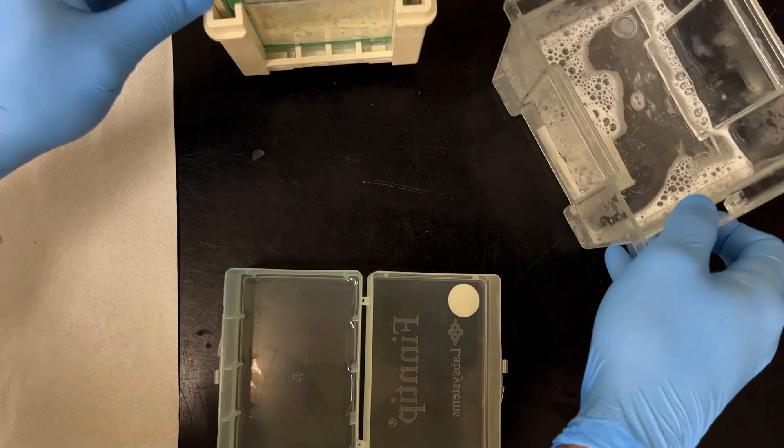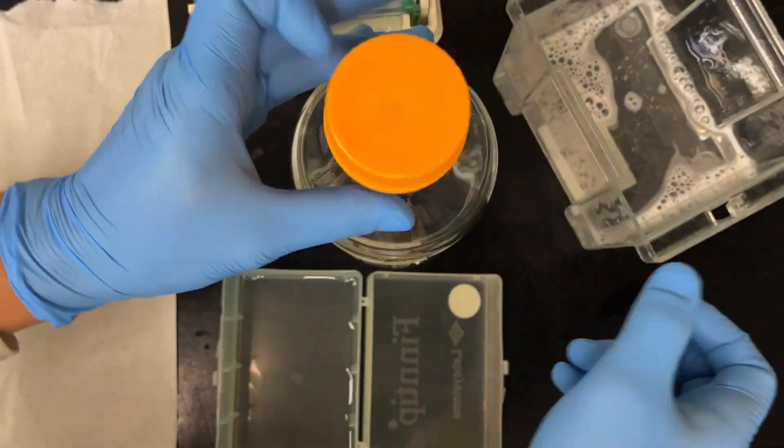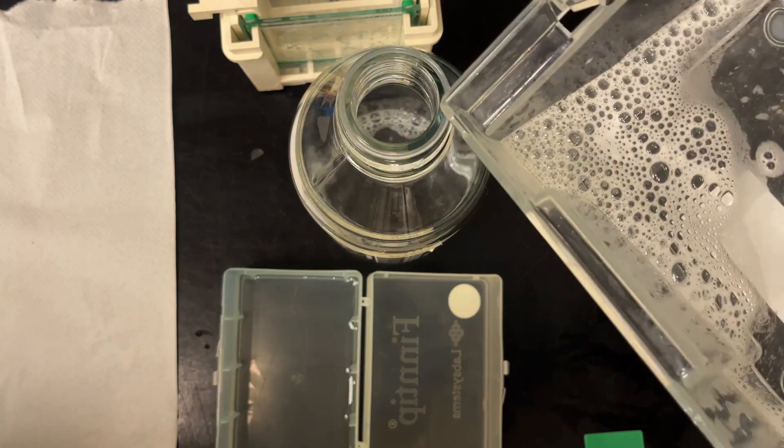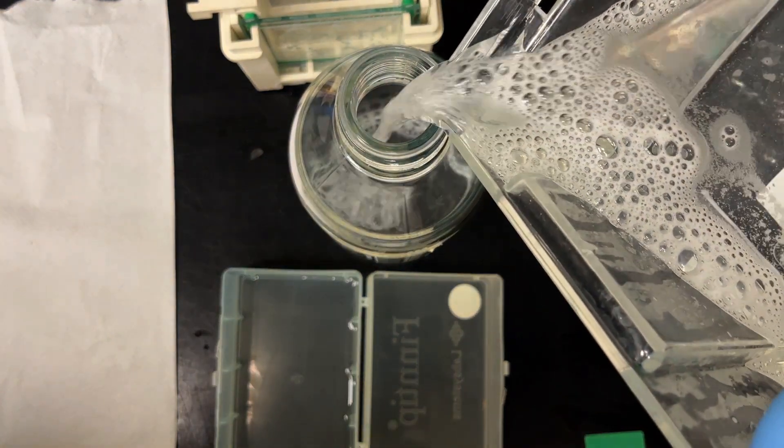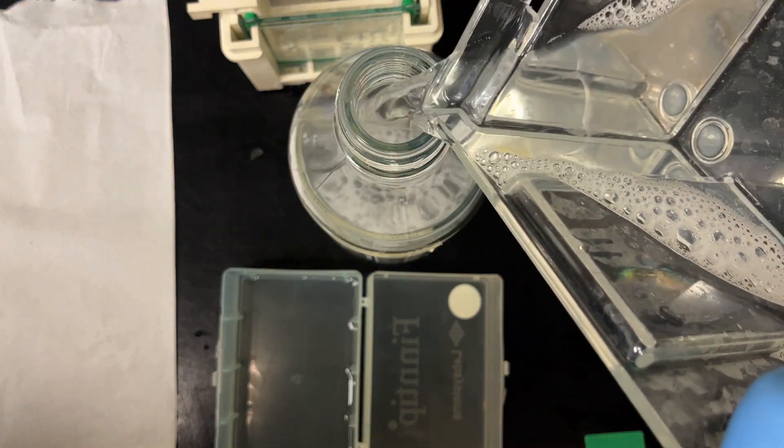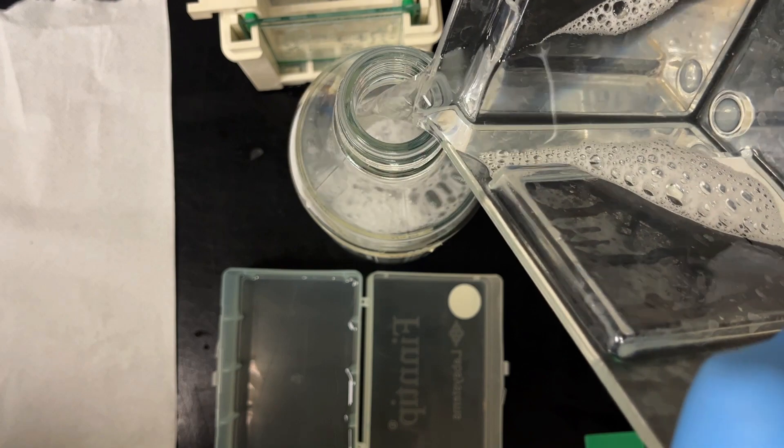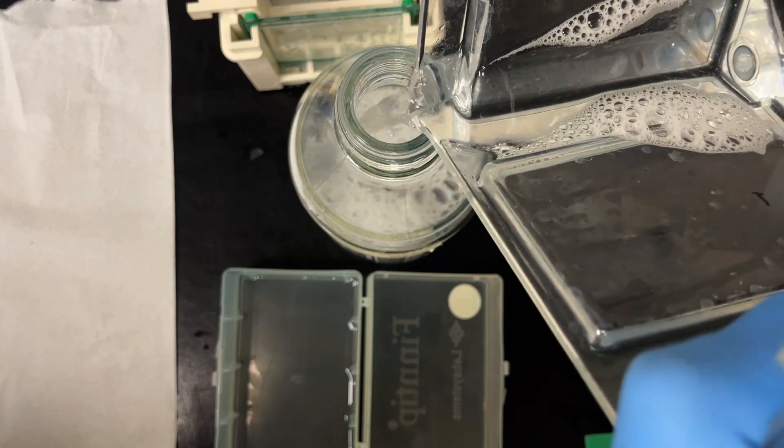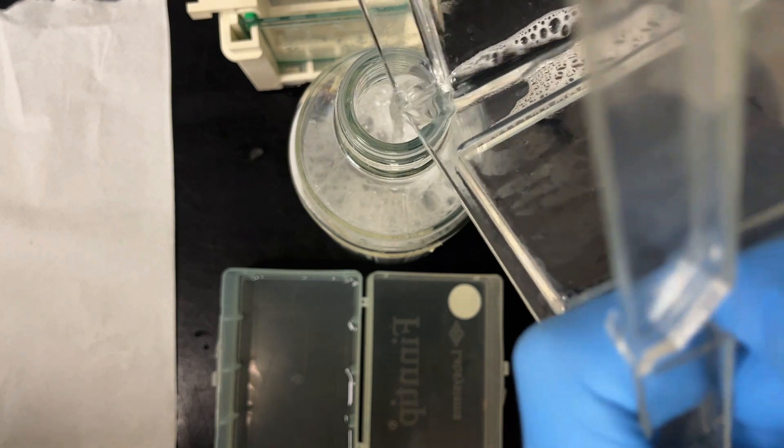So take out, put everything in the gel box. Remember what I said? We do keep the gel running buffer, right? So we simply pour it back into the bottle. I probably should use a funnel, but I trust my hands. Everything went back nice and neat. Good job, me.